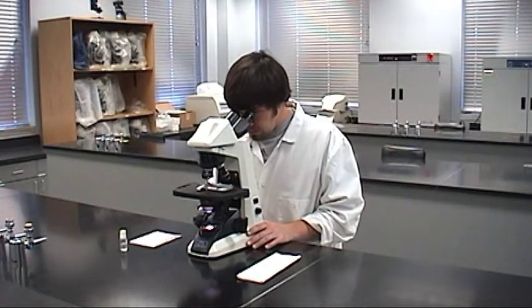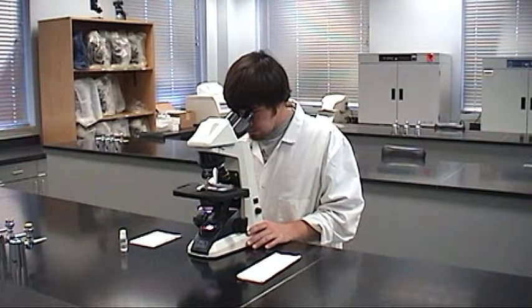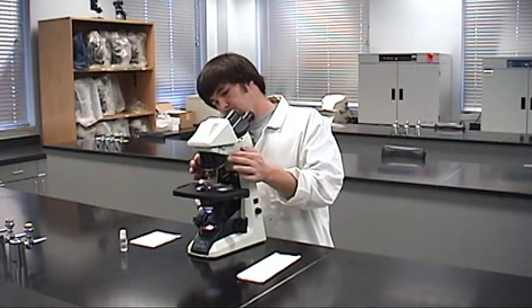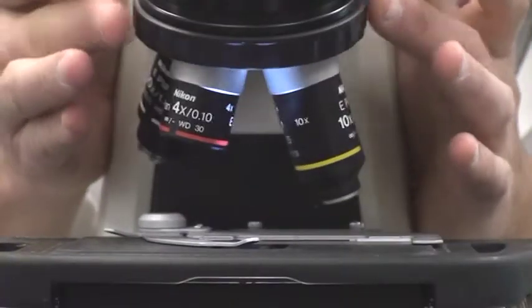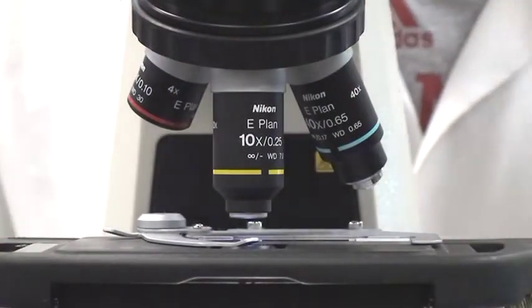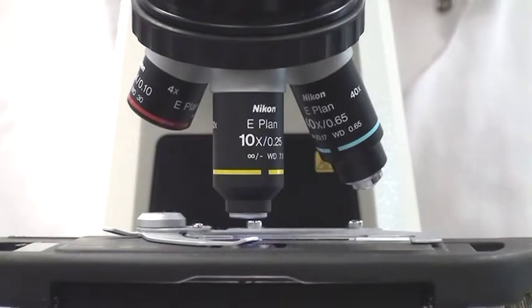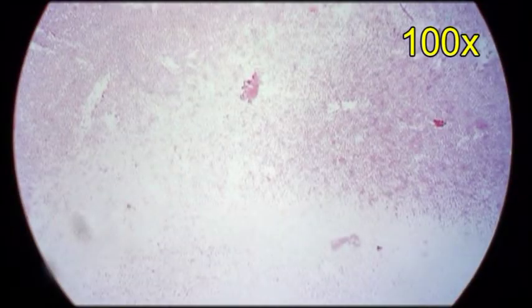Once you find an organism, increase the magnification to examine it more closely. Use the ribbed ring to rotate the nosepiece to the next objective. Never use the objectives to turn the nosepiece — they can be damaged and are very expensive to replace. Your microscope is parfocal, which means same focus. This feature helps to maintain image focus so that only minor adjustment is needed after you change objectives.